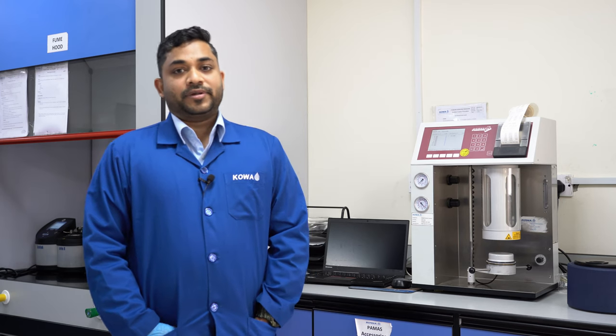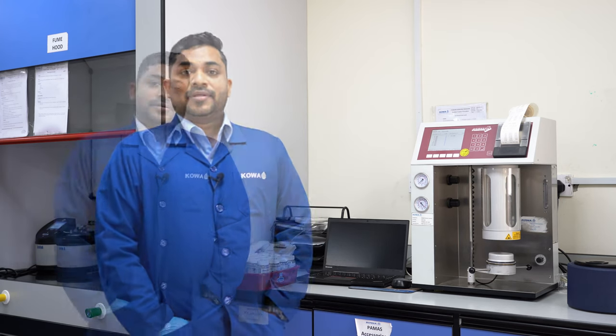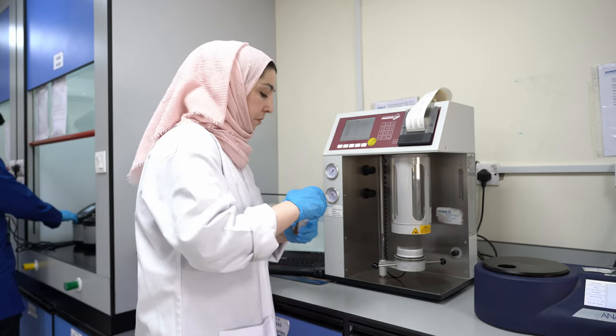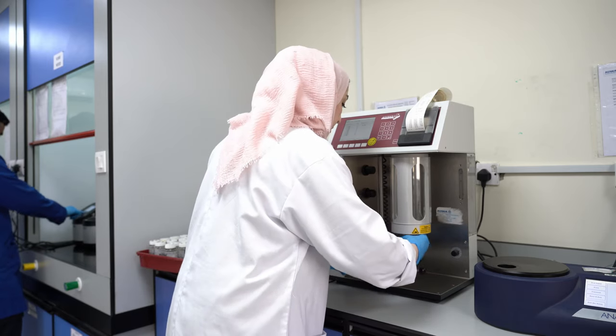Particle count is performed on hydraulic oil and brake oils using the laser technique. It is used to determine the fluid cleanliness of the sample. The results are reported using ISO 4406 methods. The method measures the number of particles of specific sizes in a given volume of sample.